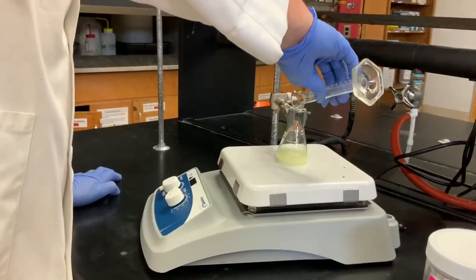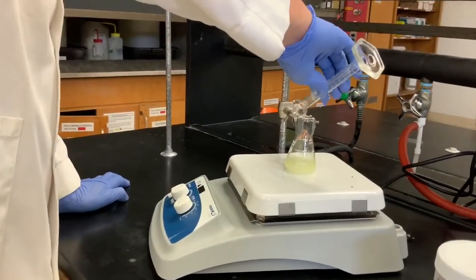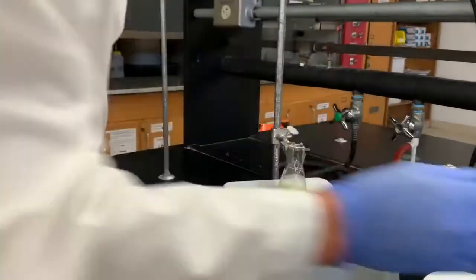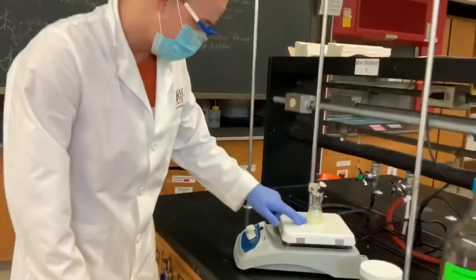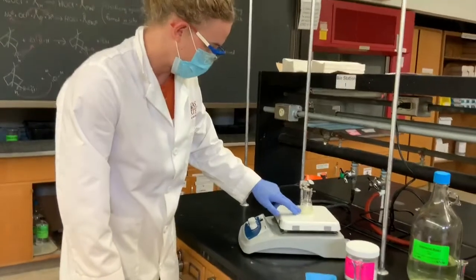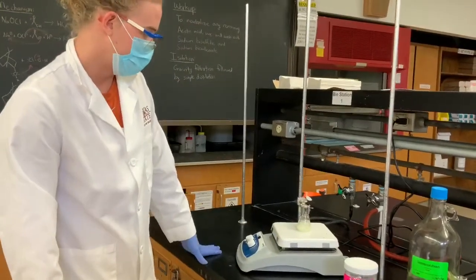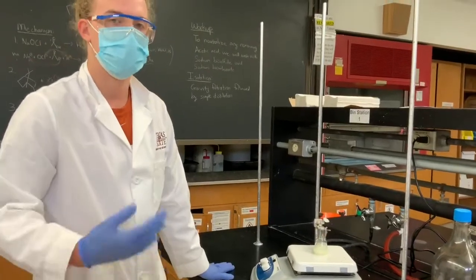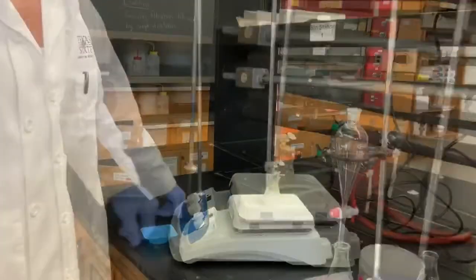It's a very fast reaction — you can see the color change. We'll stir it for 15 minutes, and you can already start to see some white solid precipitating. That's going to be your camphor. It's a very good reaction. 15 minutes at room temperature.